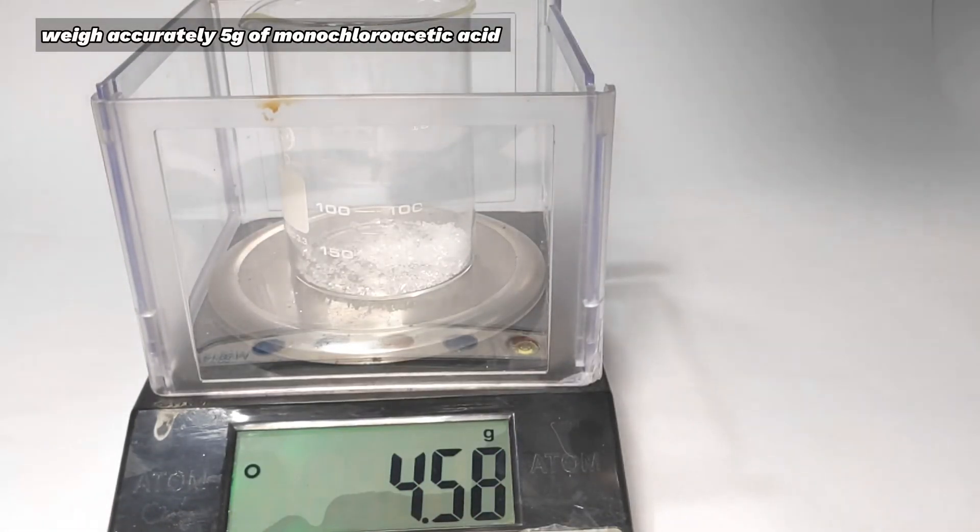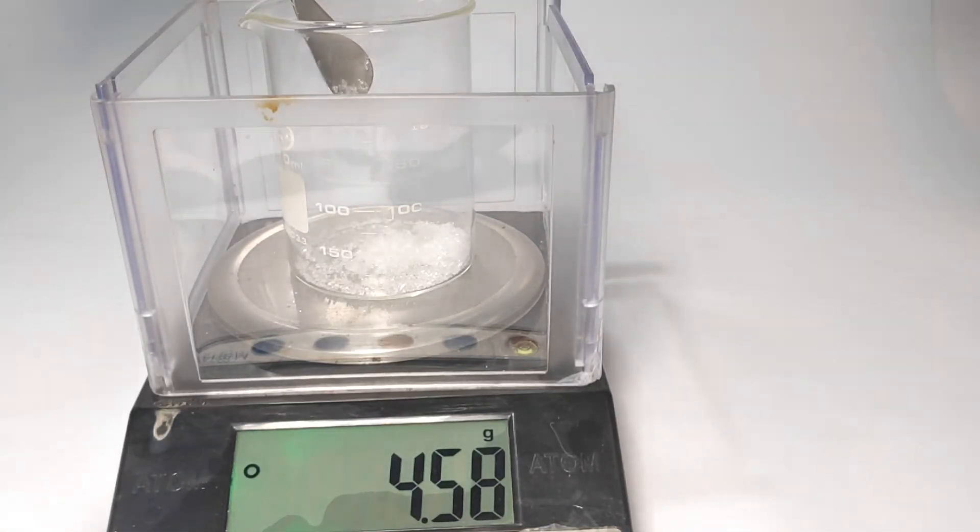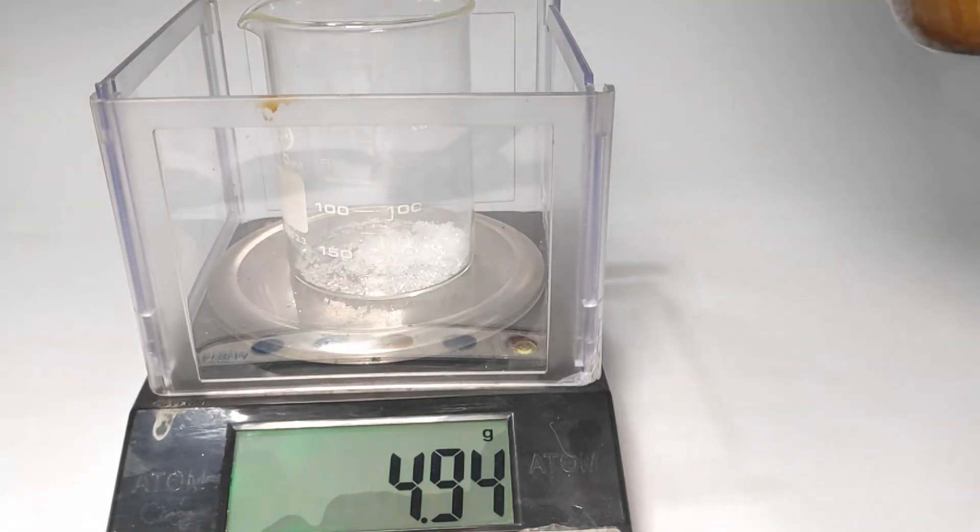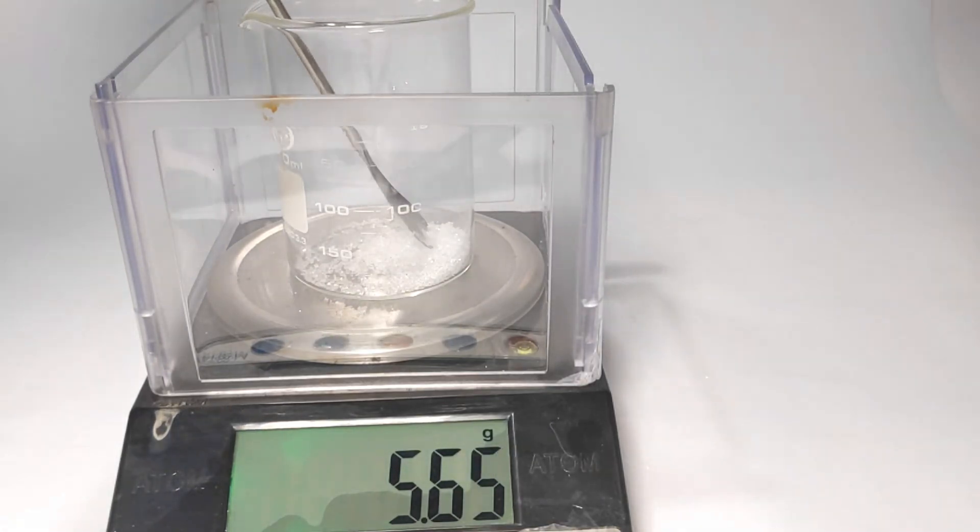Next, 5 grams of monochloroacetic acid was weighed out. A word of precaution on monochloroacetic acid: even though it looks like sugar crystals, contact with skin would result in unpleasant burns, so handle with extreme care.